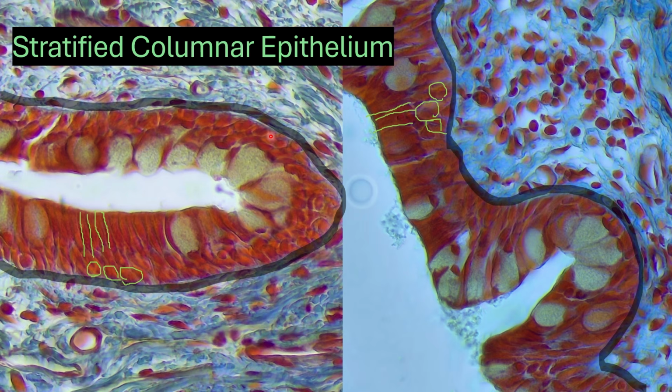Now do note though, in a lot of these transitional zones, stratified columnar and stratified cuboidal epithelium can be found very close to each other. So be careful and recognize about an approximate at least 2-to-1 ratio between the height and the width to distinguish between cuboidal versus column-like. That's a general rule of thumb.